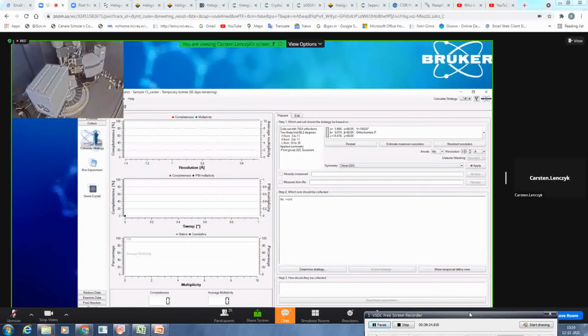And you see here, it already suggests a resolution it could collect. For that, we would go to a reasonable one. Basically, for molybdenum, I always suggest 0.75. With the fast scan, you most of the time have the ability to already make a pre-structure solution, so you will also get a hint about the space group most of the time. So if you know that your structure is chiral, you can select it here. Of course, you can also say centrosymmetric.